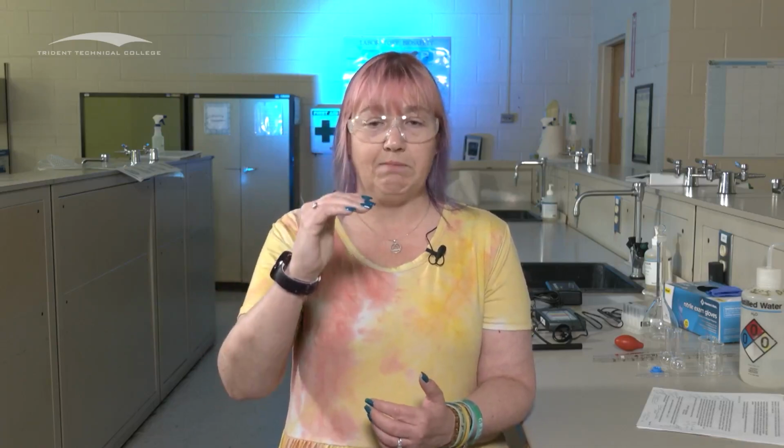And then we need to talk about potential errors. Everything that I measure has a potential error that can go with it. So if I'm using one of these volumetric pipettes and I'm not particularly skilled at doing so, there are errors in the way that I may be doing that. It may be too high, it may be too low. There are inherent errors in that particular measurement. If I'm particularly precise in how I do it, then I don't have to worry about those errors. But if I'm not precise, I need to be honest about that. Okay? That's something that I need to record when I'm doing my data collection.